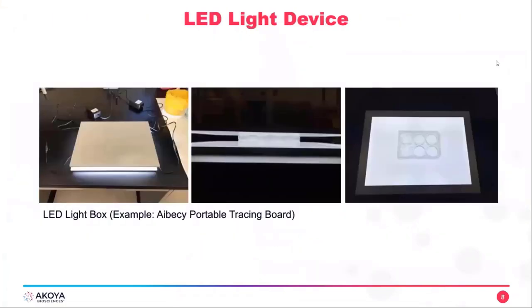This is the LED light device. You can get these LED light boxes on Amazon like we did. You can see in this left picture that the LED light boxes fit on your bench space, they don't take up too much space, and they will fit in any typical outlet. In this middle image, you can see that we use the 6-well plate that you use for existing CODEX protocols, and the LED light boxes go directly over top and directly beneath the 6-well plate. This is a very easy setup.